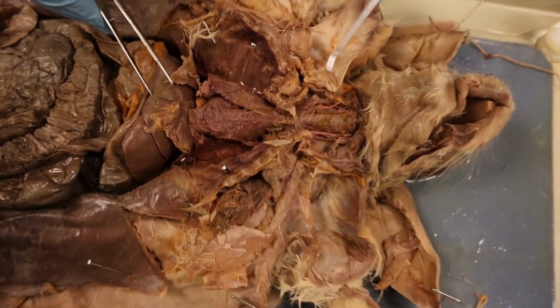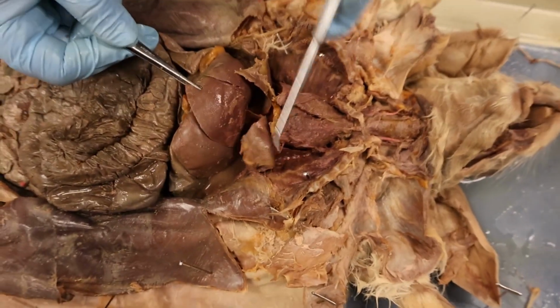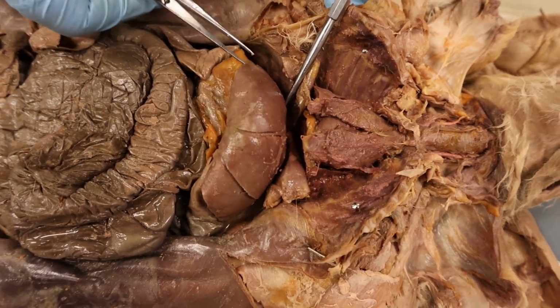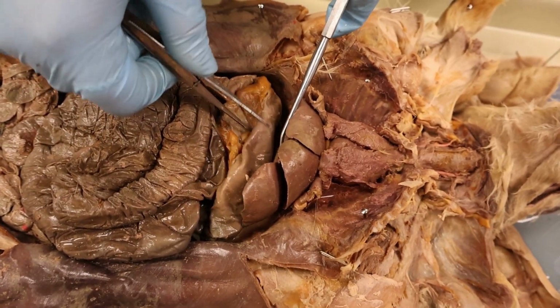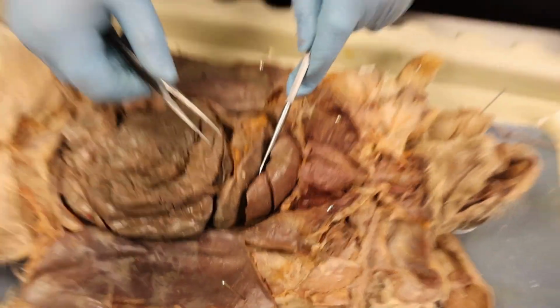Alright, from this esophagus we're going to go down and make a pit stop at the liver. This liver is going to filter out toxins throughout the body and generally help with extracting nutrients from waste.